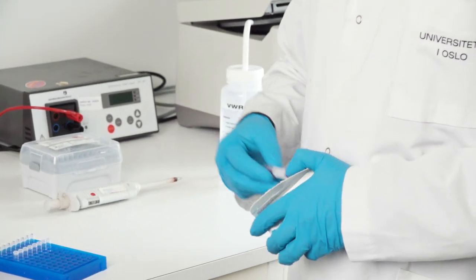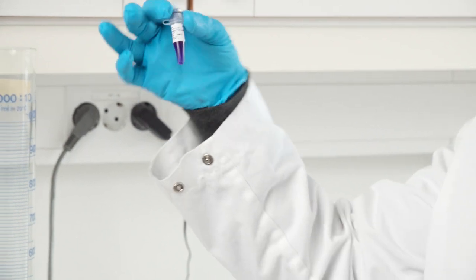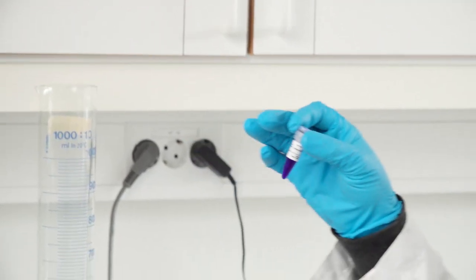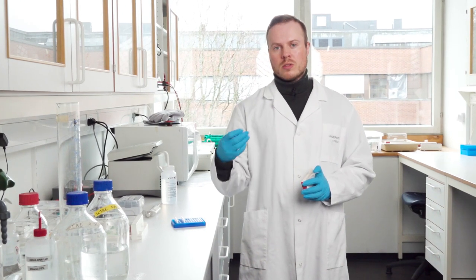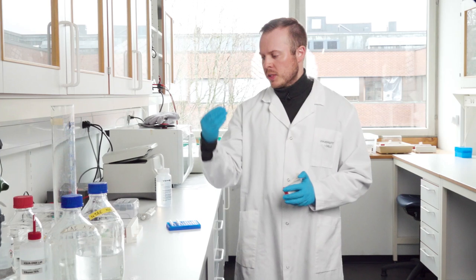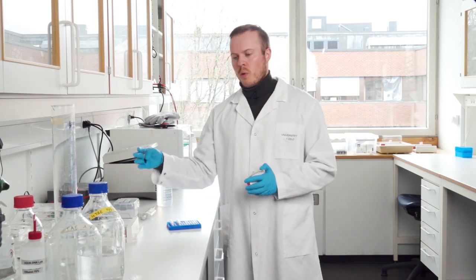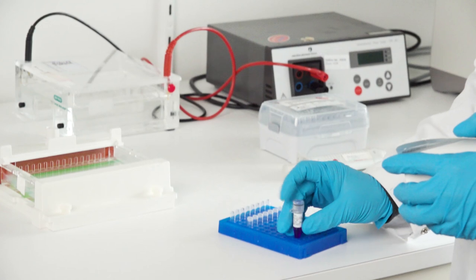One of the compounds is something called a gel loading buffer. It's very darkly purple-bluish and this is heavier than water and it also kind of binds to the solution so it pulls down the samples into the gel so it's not going around in the machine. So that's a very important thing.